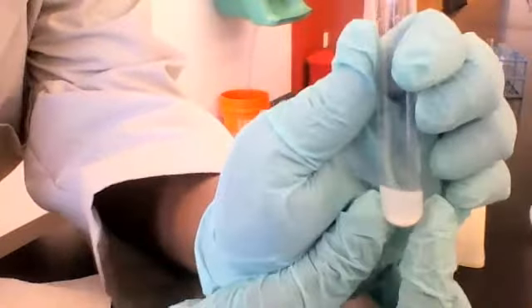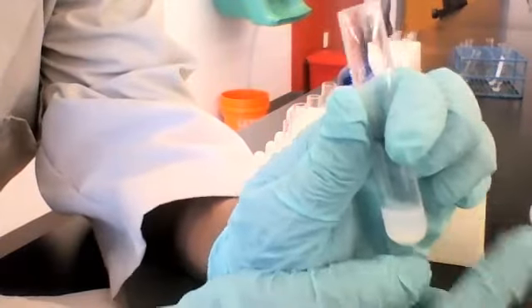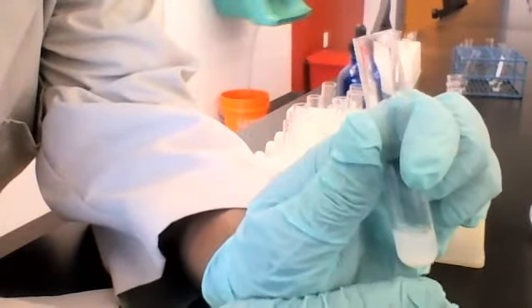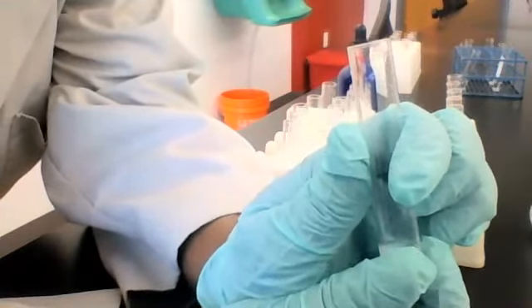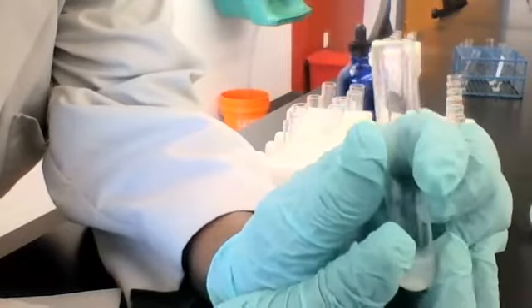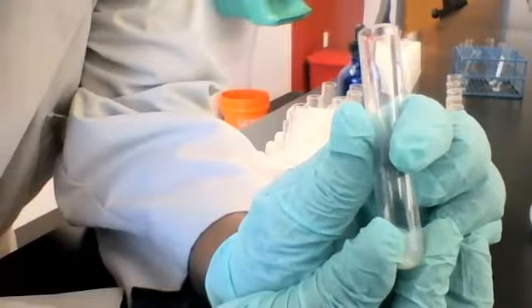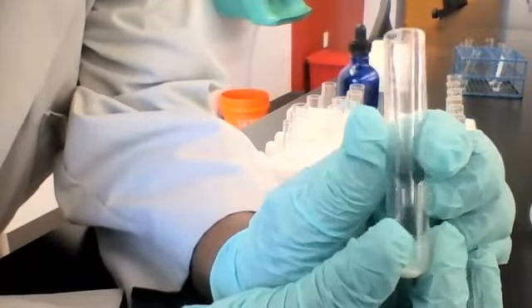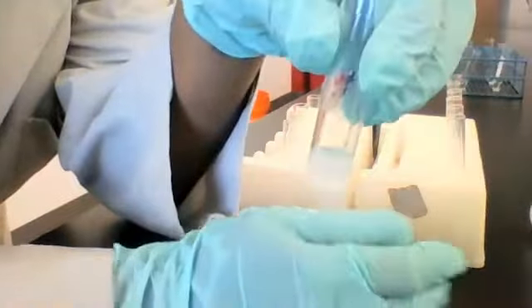Now, the word solution means that one can dissolve into another, right? Solute dissolved into a solvent. And if it was dissolved, there'd be no solid left, right? It would be all liquid. And because it's aqueous, you'd be able to see right through it.